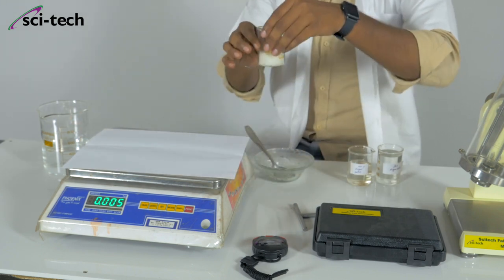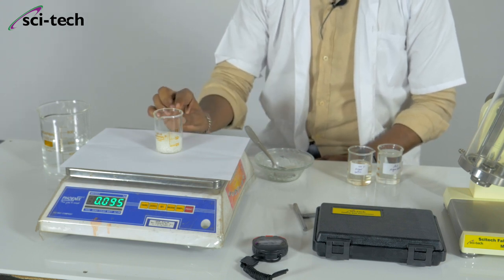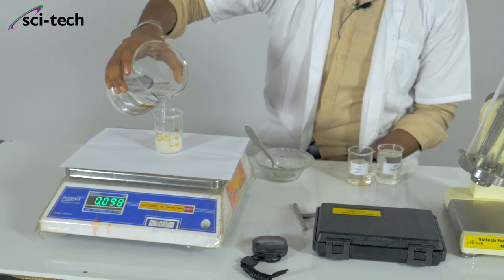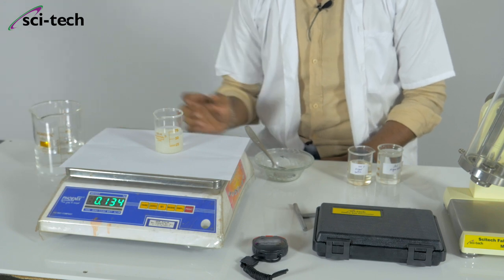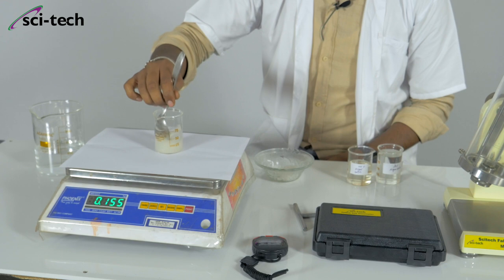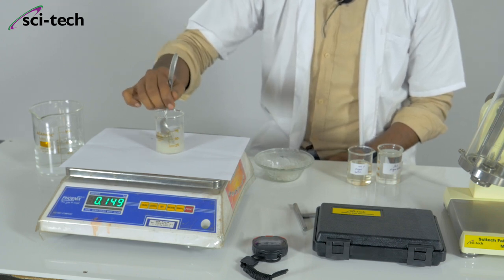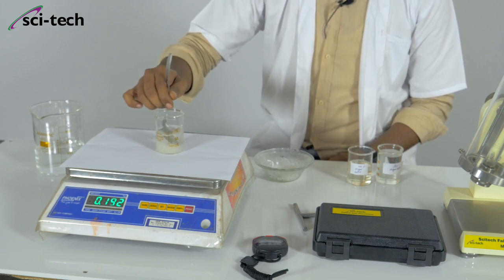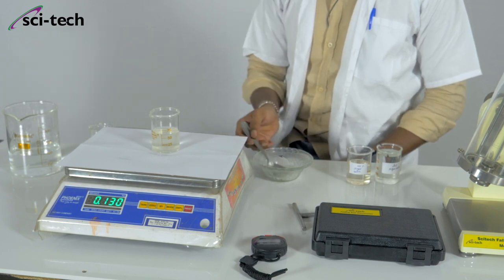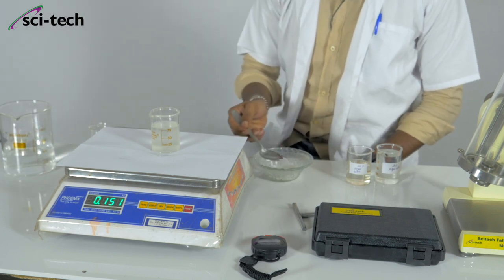This is our 100 ml beaker. We will not add the full 100 ml of water at once — we add a small amount of water 3 to 4 times inside the beaker to make a dense liquid. We pour a little at a time and then constantly stir it until the sugar is dissolved in the water.